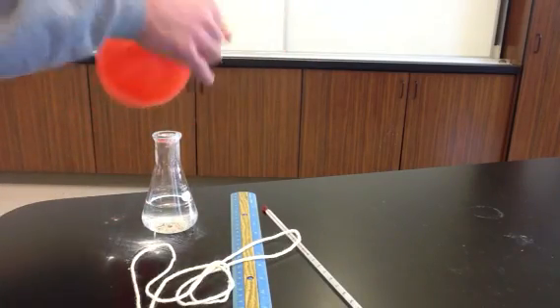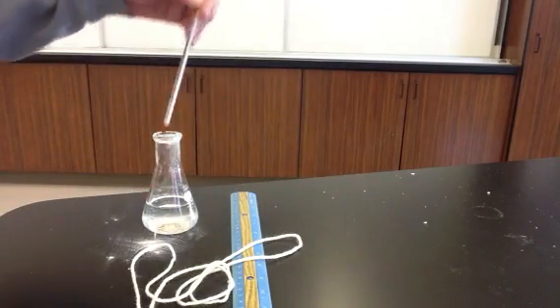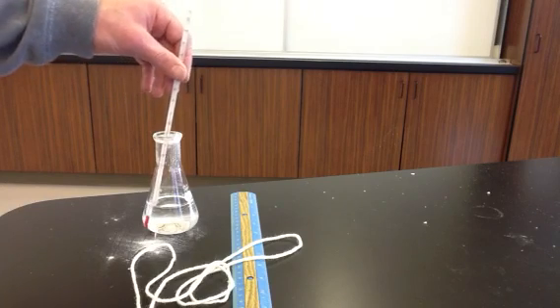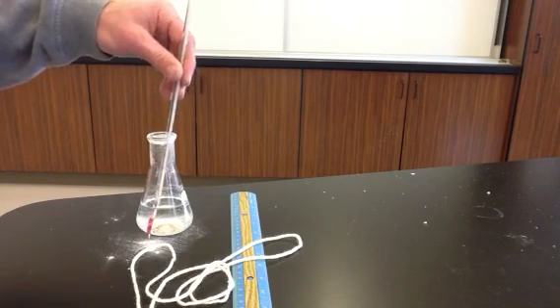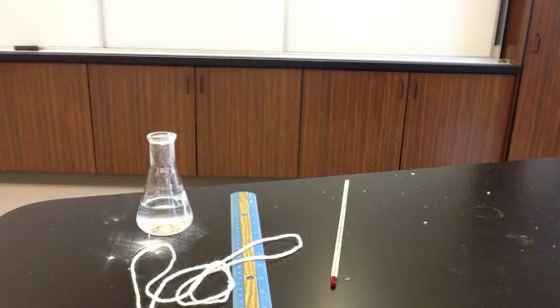We're going to release the carbon dioxide now. We don't need that anymore. And we're just going to measure the temperature. We'll measure the temperature of the solution here. That'll be pretty much the same temperature as the gas. And it looks like 19 degrees Celsius is our temperature in our solution here. So we'll assume that the temperature of the gas was also 19 degrees Celsius.